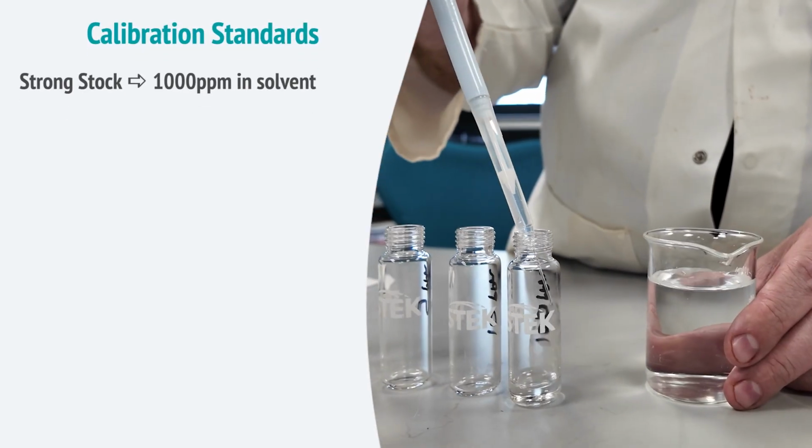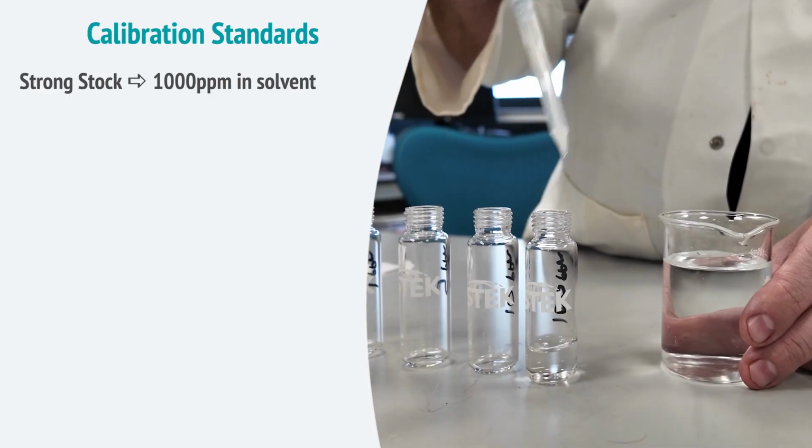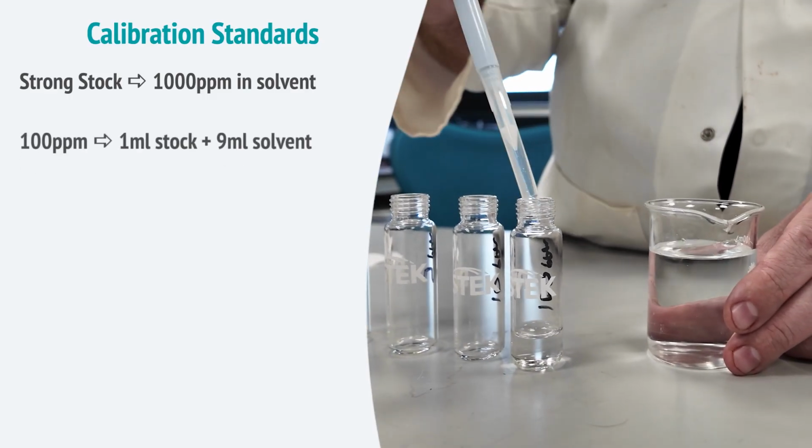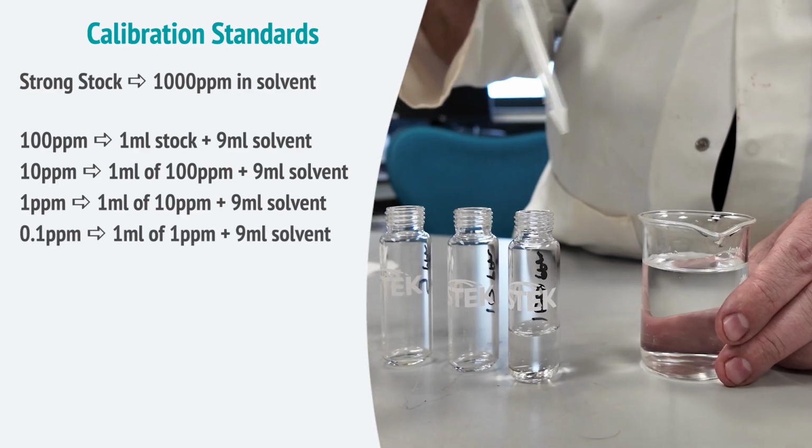To measure VDKs like diacetyl and acetylpropionyl, we first need calibration standards. These are known concentrations that tell the GC exactly what each level looks like. So we're going to start with a concentrated stock at 1000 parts per million, and then we're going to step down 1 to 9 each time to make 100, 10, 1, and 0.1 ppm.